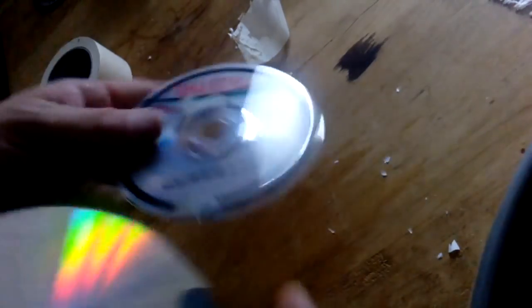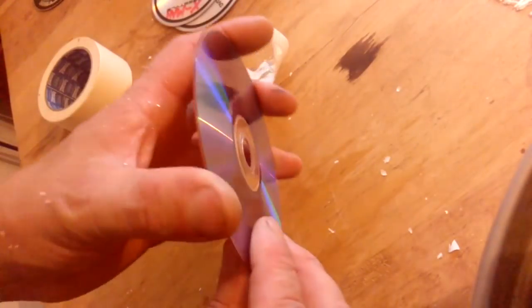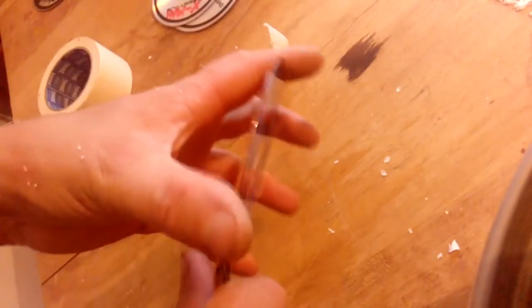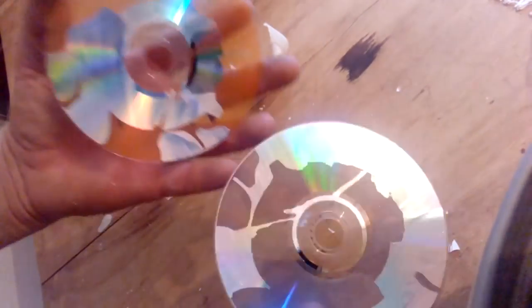See that? So we got some silver here, but we got a lot of silver here. And now just put it on the side. The bulk pieces. It's better with light. Okay. Now we got some other. Okay. This is different but practically it's the same. So you just find the place and go round. See that? You already exposed the silver, and just put it on the side.